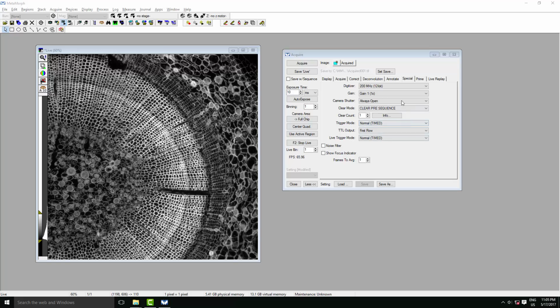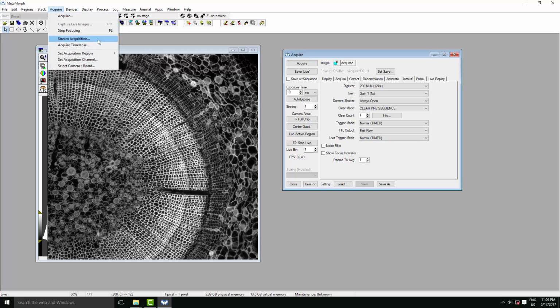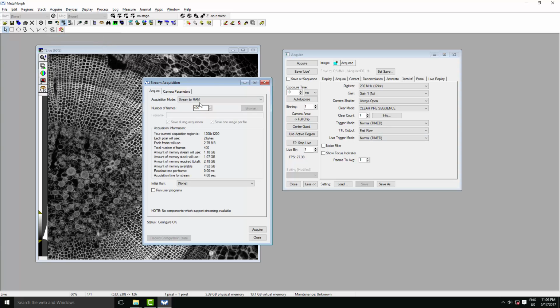Now we'll have a quick look at taking movies and time-lapse. There's one quick setting that you may want to change whether you're taking a movie or a time-lapse, and that's in the Special tab. You'll want to have a clear mode of pre-sequence, which is the default if you're taking a movie or just doing normal acquisition, or pre-exposure if you're taking a time-lapse where you'll wait between frames. So then, to take a movie, we go to Acquire, Stream Acquisition. Here we can specify the number of frames that we want to record, and whether we want to stream to the RAM, which is faster, or stream to the hard disk, which allows us to capture for longer without running out of RAM.